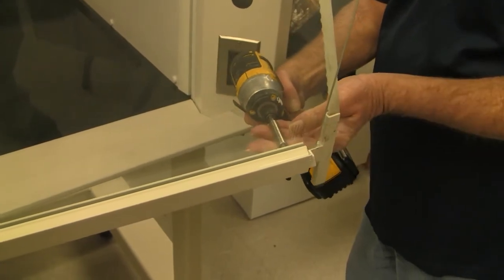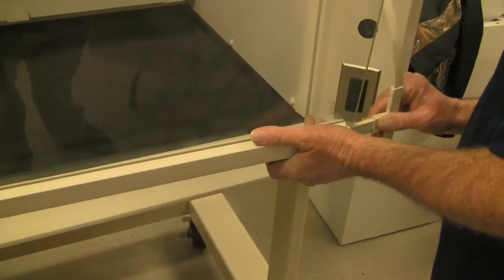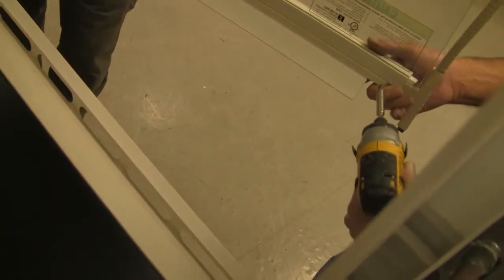Once the sash is free of the hood, remove the two screws in the handle holding the belts onto the sash.